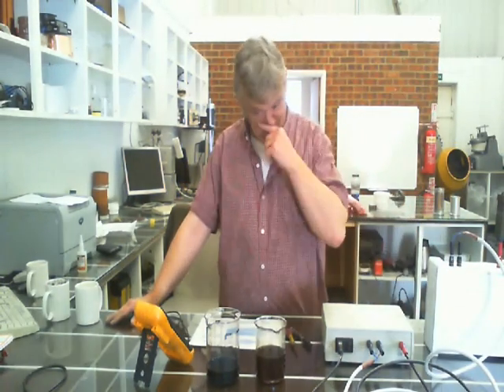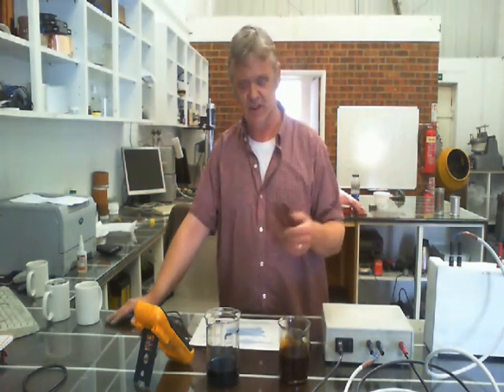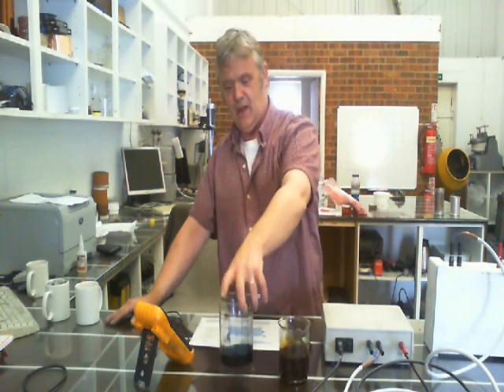To give this sintering unit a go so we can have a play with it, what I did was make some copper nanoparticles in here, and they're pretty small, which is why it's that blackish colour. It's actually kind of a deep golden colour when you look at it, and when it dries it's kind of a greenish colour actually. And we've got some metal organic copper ink there that I ran off.